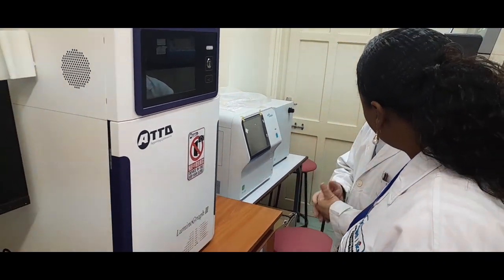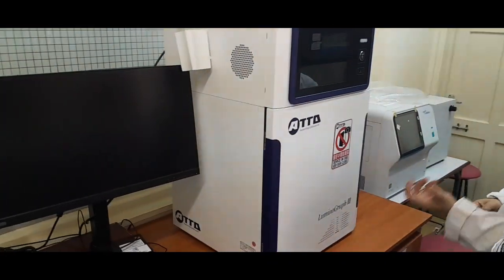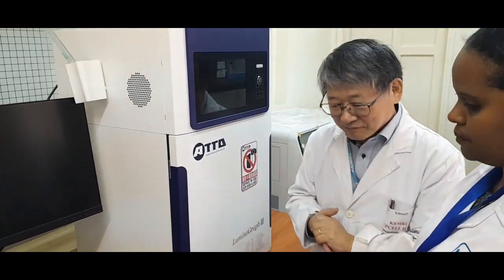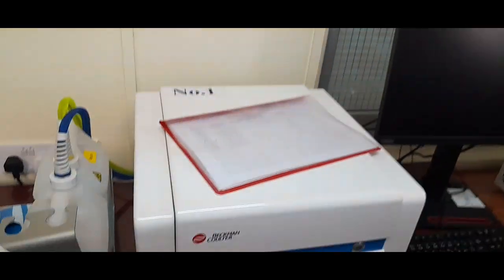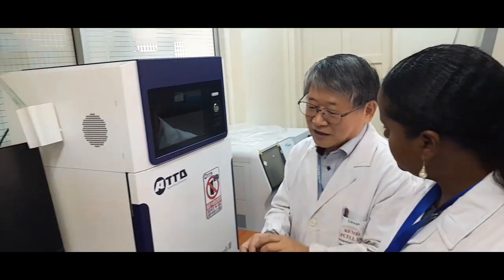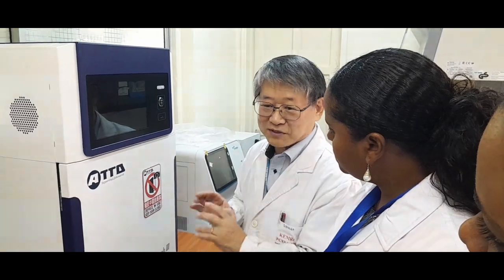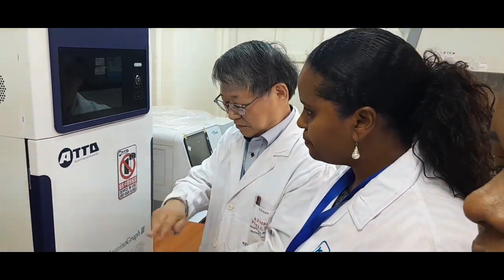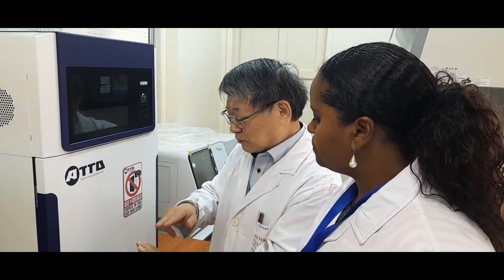In case we start the clinical research and collect samples for HIV, we can do that too. Not only CD4, CD8, but some others also. By staining the cells with a specific antibody, we can calculate the number of cells and how much before infection and after infection, then we can compare by checking the change of the graph image.